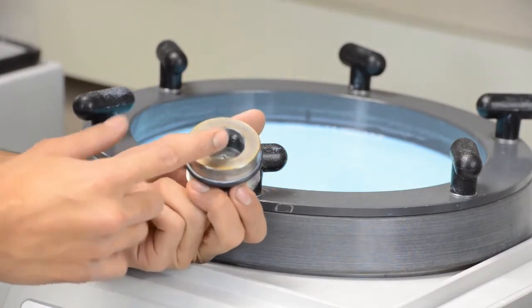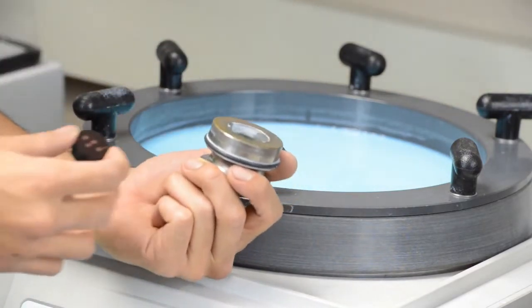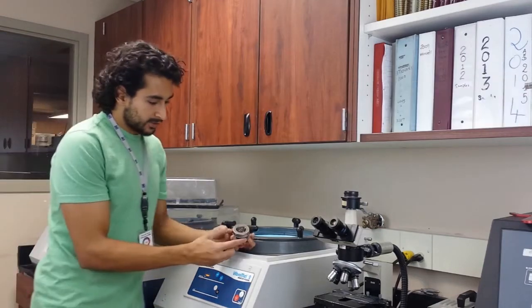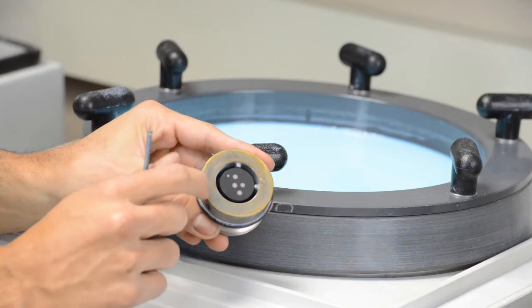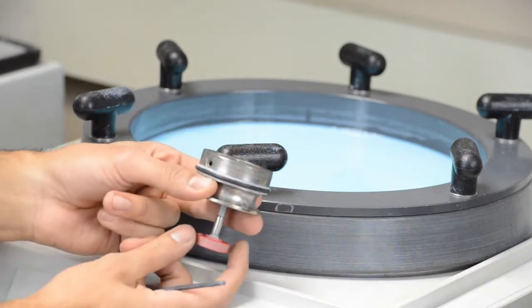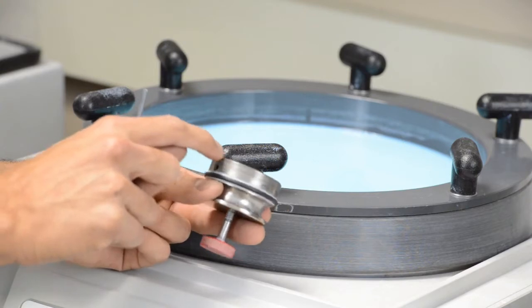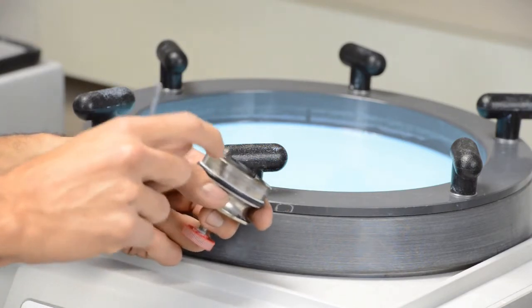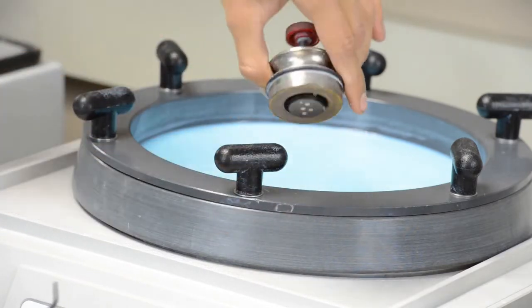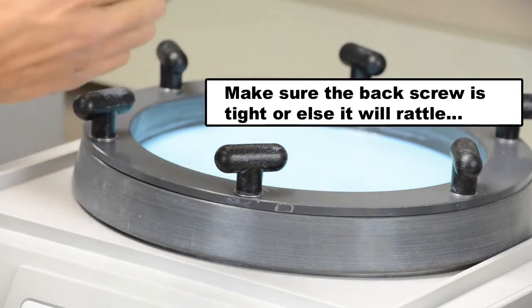And now you have these little sample holders right here. What they do is you simply hold your sample, face down, your sample is going to be the only thing touching the pad. So I put my puck, my sample in here. And right now my sample is not coming out of this metal. So if I put it face down, the metal will be polished, not my sample. So I need to take the sample out of there, push it up with this screw at the bottom. And there you go. You want your sample to be sticking out enough so that when you put this thing face down, and then you tighten this right here. When you put this thing face down, your sample is the only thing that will be touching the bottom of the bowl.